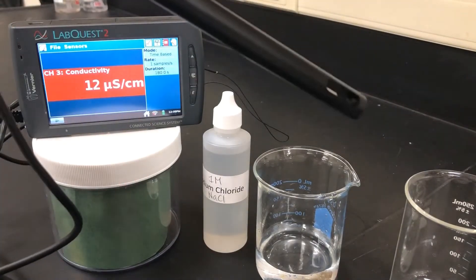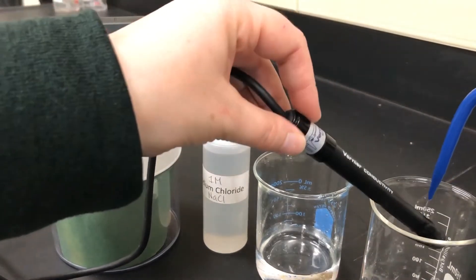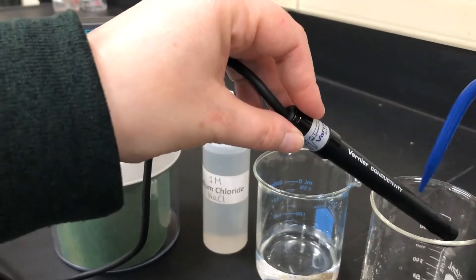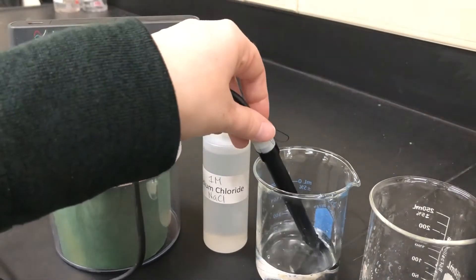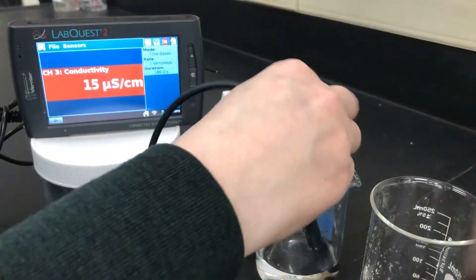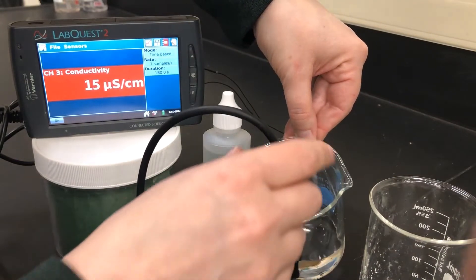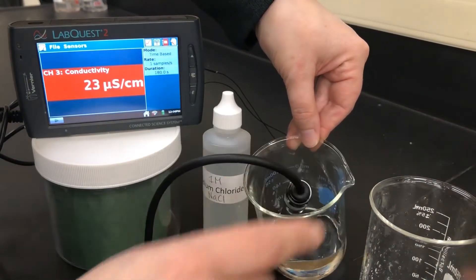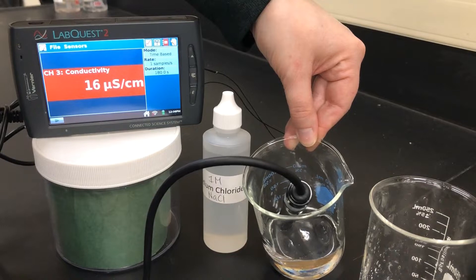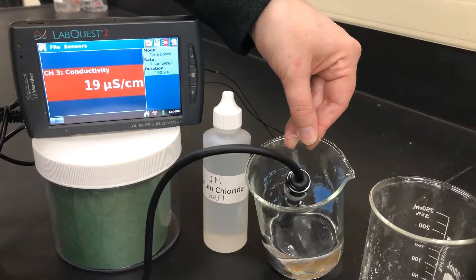We're going to use a waste beaker and our deionized water to rinse off the conductivity tester to remove any ions that may be left on there before we measure our initial water. Our initial reading of deionized water shows conductivity of 13 to 14, and wherever this number stabilizes is the one we will write down. So 16 is our initial reading for zero drops of sodium chloride.